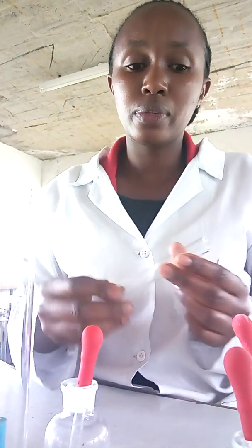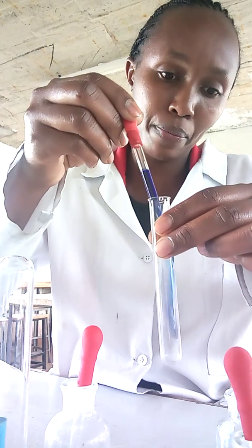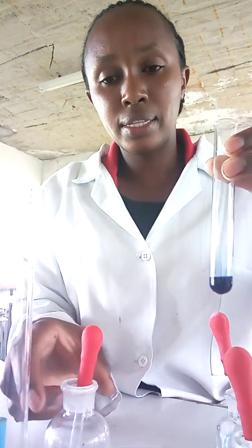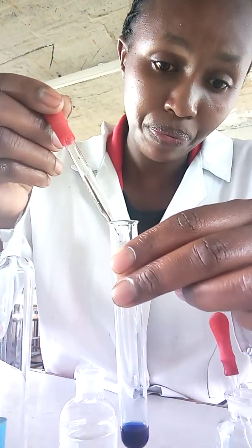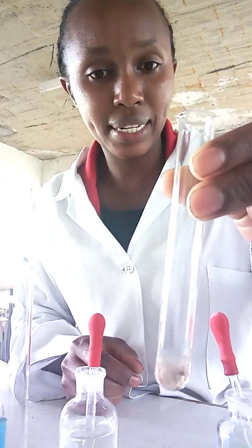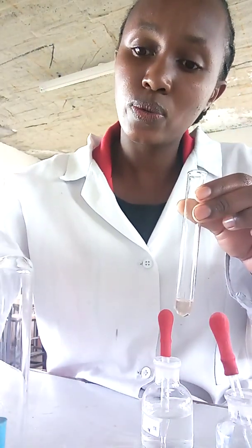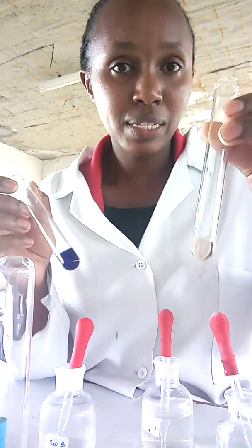For the next experiment, I'll again first put the DCPIP into my test tube, and then I'll take solution Y and add it to the DCPIP and shake. You can see there is a color change — the DCPIP decolorizes. So this was solution Y, and the one that retained the color was solution B.